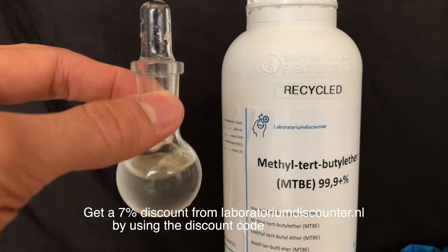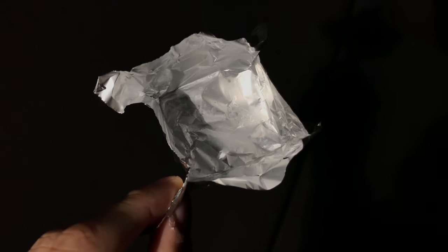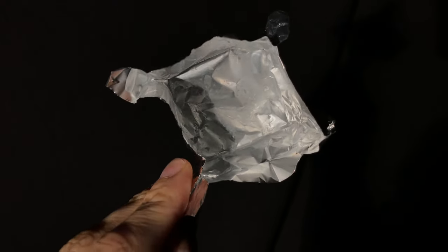The ester was extracted using MTBE and it was then transferred to a piece of aluminum foil. I only wanted to know what the ester smells like and therefore I don't need to be precise and I don't need any further purification. The only way I can describe the smell of the ester is that it's somewhat similar to pine trees. I really liked the smell and it was worth making the ester.